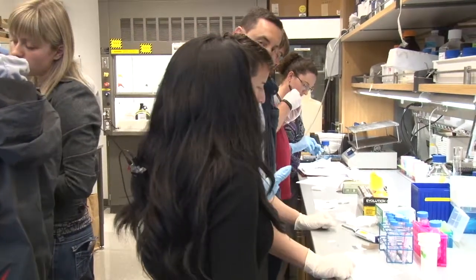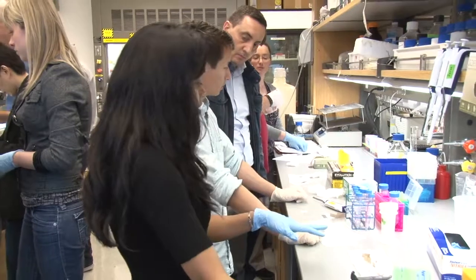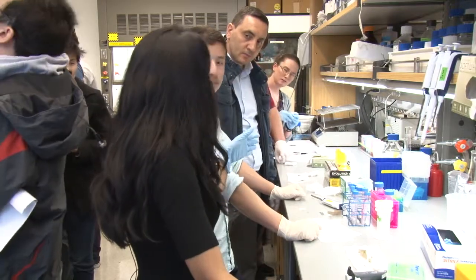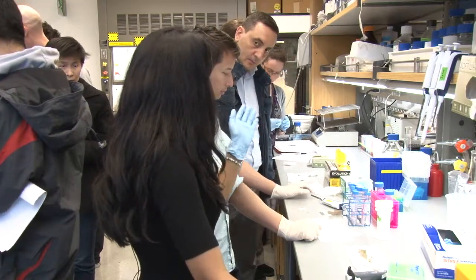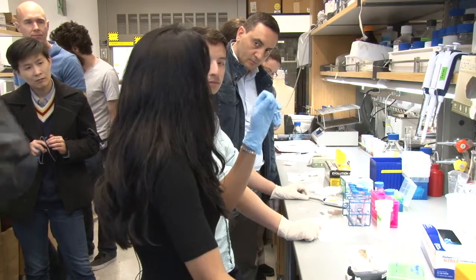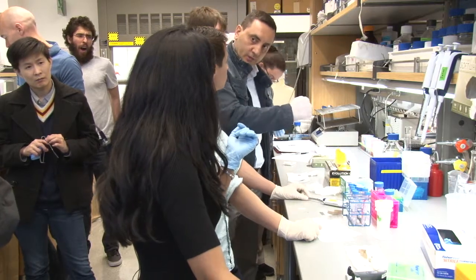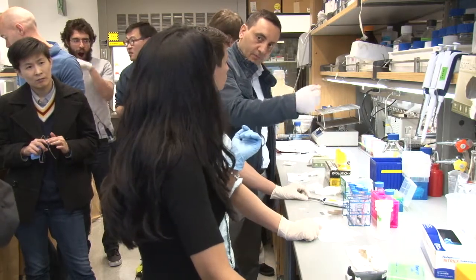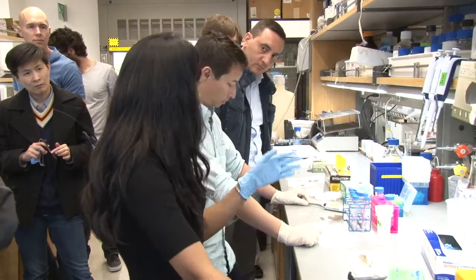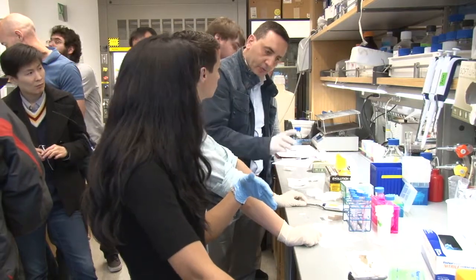If you're going to do just in situ hybridization, and if you were to do an immunostaining after this, you wouldn't be removing the seal chamber yet. You would add your detection oligo, wash off the excess with PBST, and directly move on to your immunostaining protocol. Once you're done with immunostaining, you would add DAPI and then remove your seal chambers. So you would add blocking, wait, add primary, wait, wash, then add secondary, wash, then add DAPI, and only then remove the seal chamber.